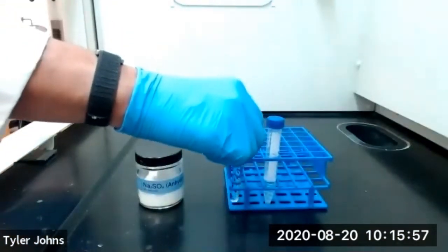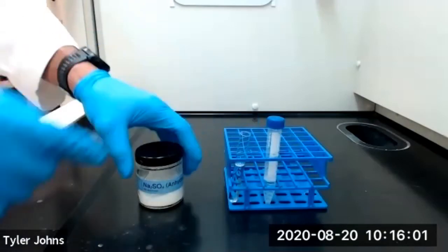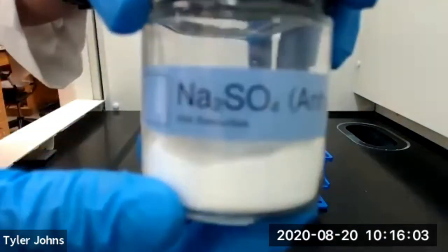We're now going to completely dry our organic layer using anhydrous sodium sulfate.